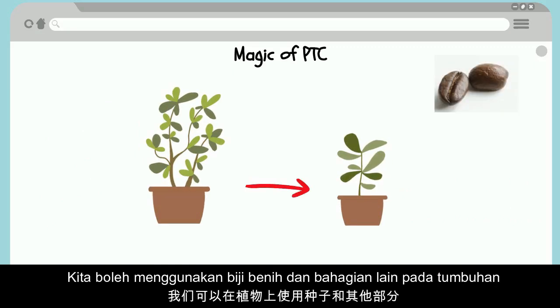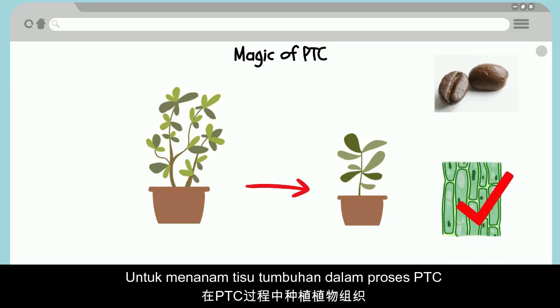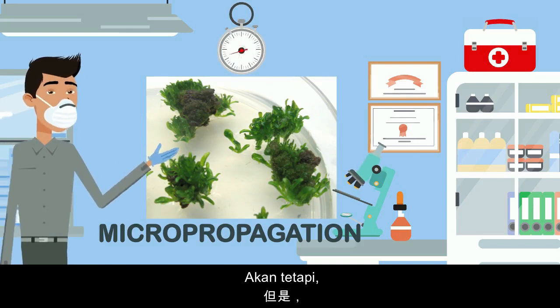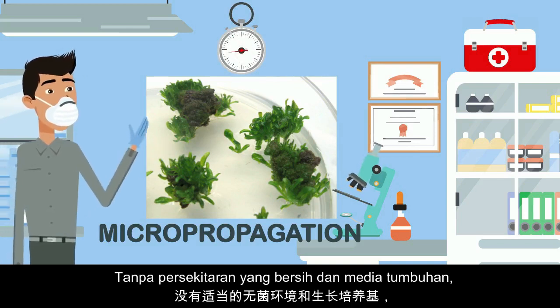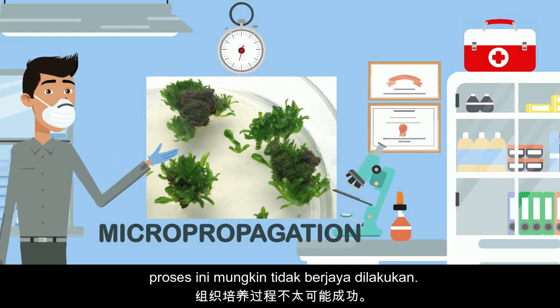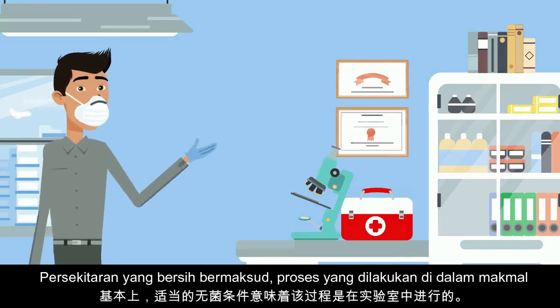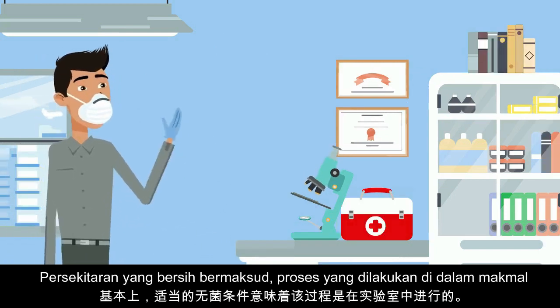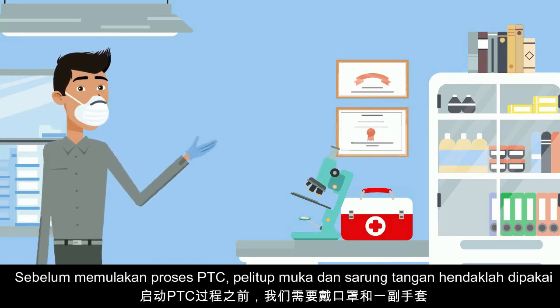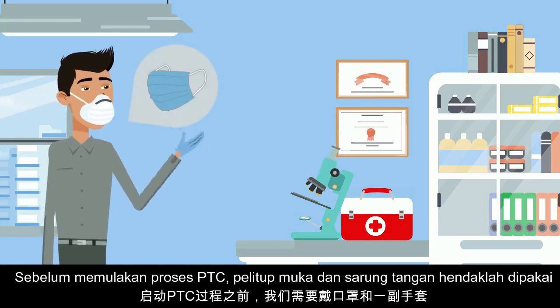PTC is a rapid planting process where we produce plants from the plant. We can use seeds or other plant parts to harvest plant tissue. However, without a proper sterile environment and growing medium, the tissue culture process is unlikely to be successful. The sterile condition means the process is carried out in the laboratory. Before starting, we need to wear a mask and a pair of gloves.